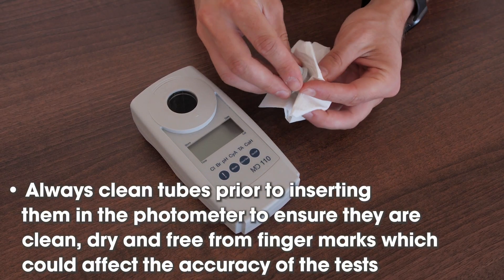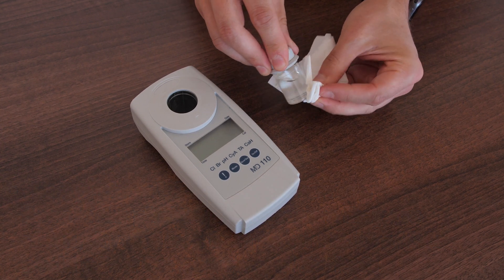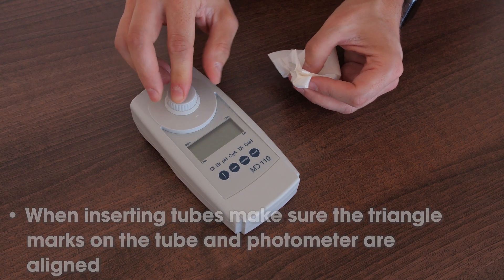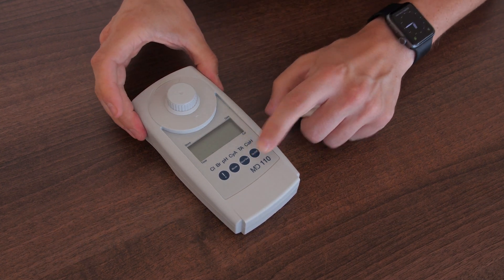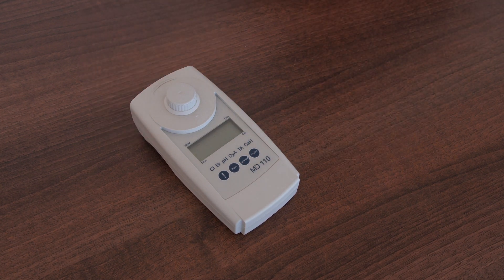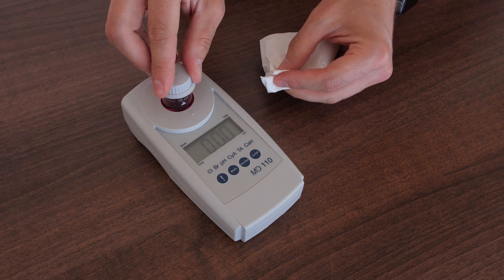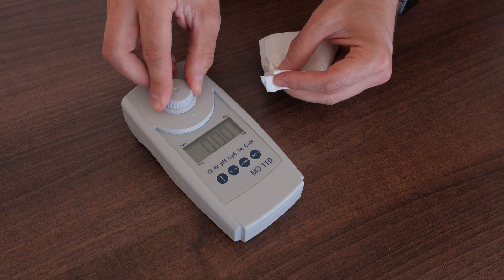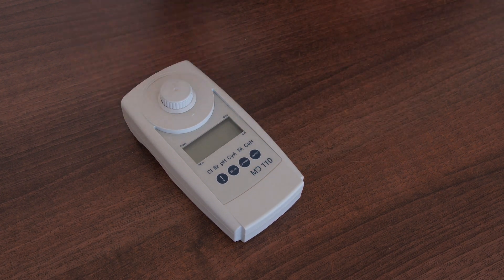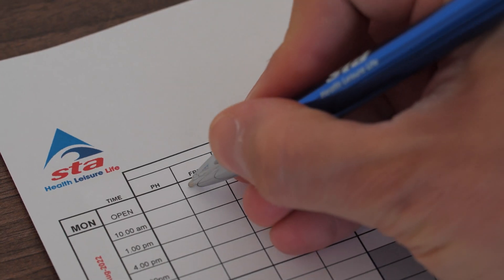Fill the empty tube with pool water to the 10 ml mark for use as the blank. Insert the tube filled with plain pool water — the blank — switch on, select free chlorine test mode and set the zero. Insert the pink sample and measure the free chlorine. Record the results.